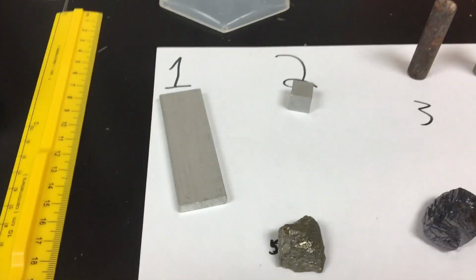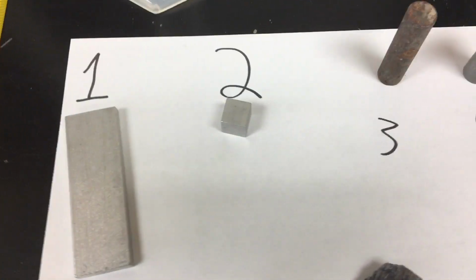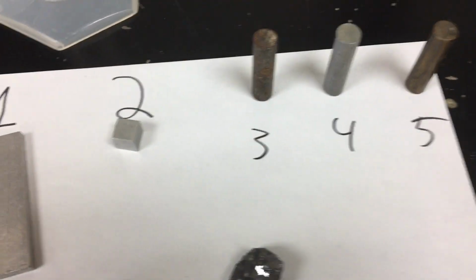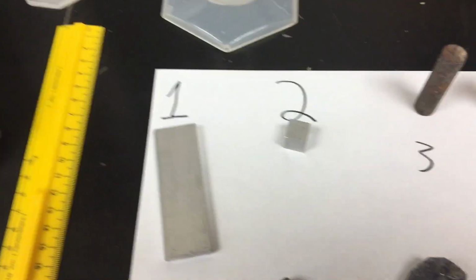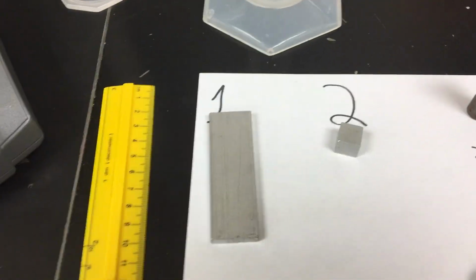He's excited. It's time for the density lab. So what we're going to do, you're going to probably have to pause the video a couple times or rewind it, but what we're going to do is work our way through the basic densities of these things through a couple of different methods. I'll try to do this on my phone the best I can. No promises. We'll see how it goes.